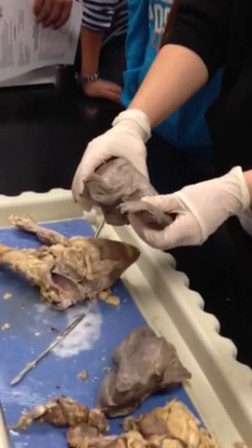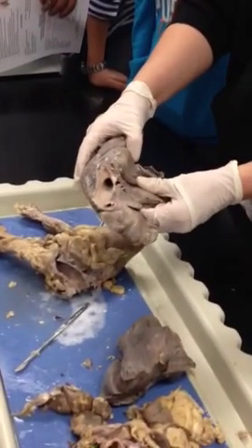Does that make sense? Yes. Does anyone have any questions about any of this? Do you want me to go over those lobes one more time?